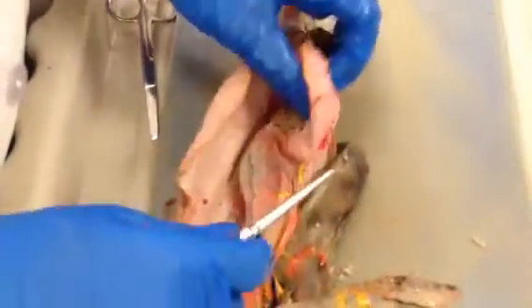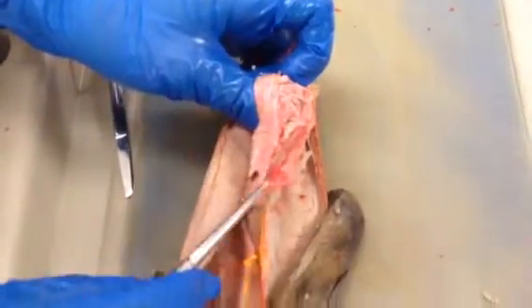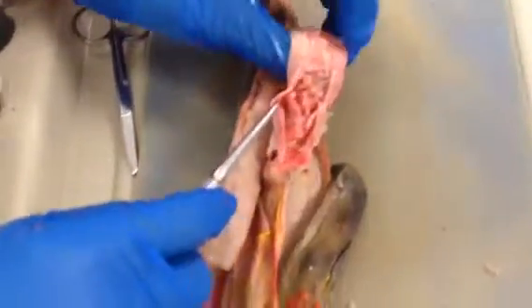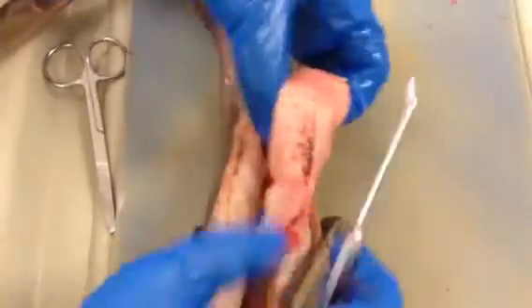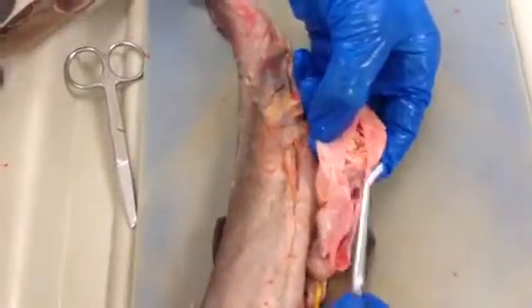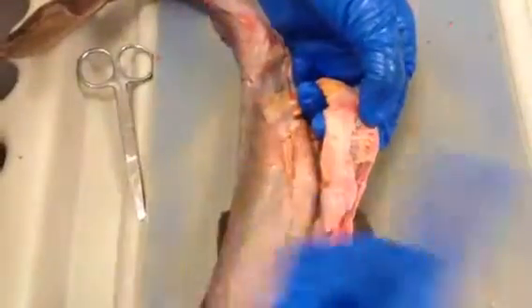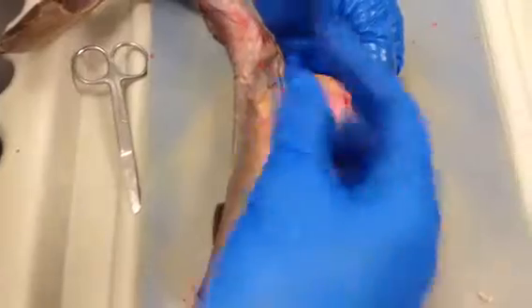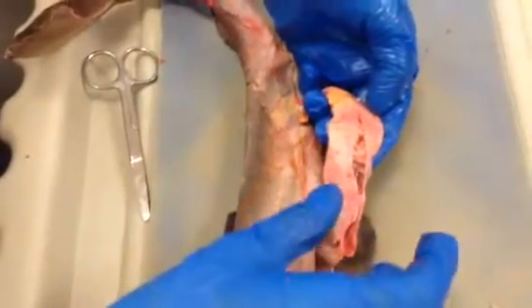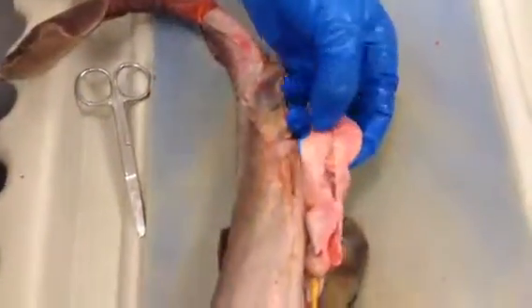Alright, so picking back up where we left off over here in the digestive tract, we have the duodenum here, right? Then that goes into the valvular intestine. When we cut it open, it has this spiral valve, so it's kind of like a spiral slide. So the food goes around and around. That gives it a lot more surface area to absorb nutrients than if the food just went from here to here.